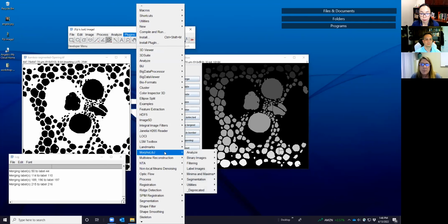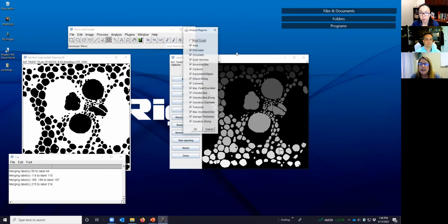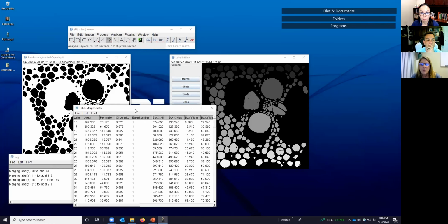To do that, we go back to our plugin, and there's an analyze tool. At the top, we're going to say analyze regions. You see that there are a number of different things that we can calculate in this case. You can do all of them, or we can do some of them. It's really simple to turn them off. You just uncheck them, and the output table will eliminate those. I'll leave a few of these checked and say okay. And you see that the calculation is pretty quick.